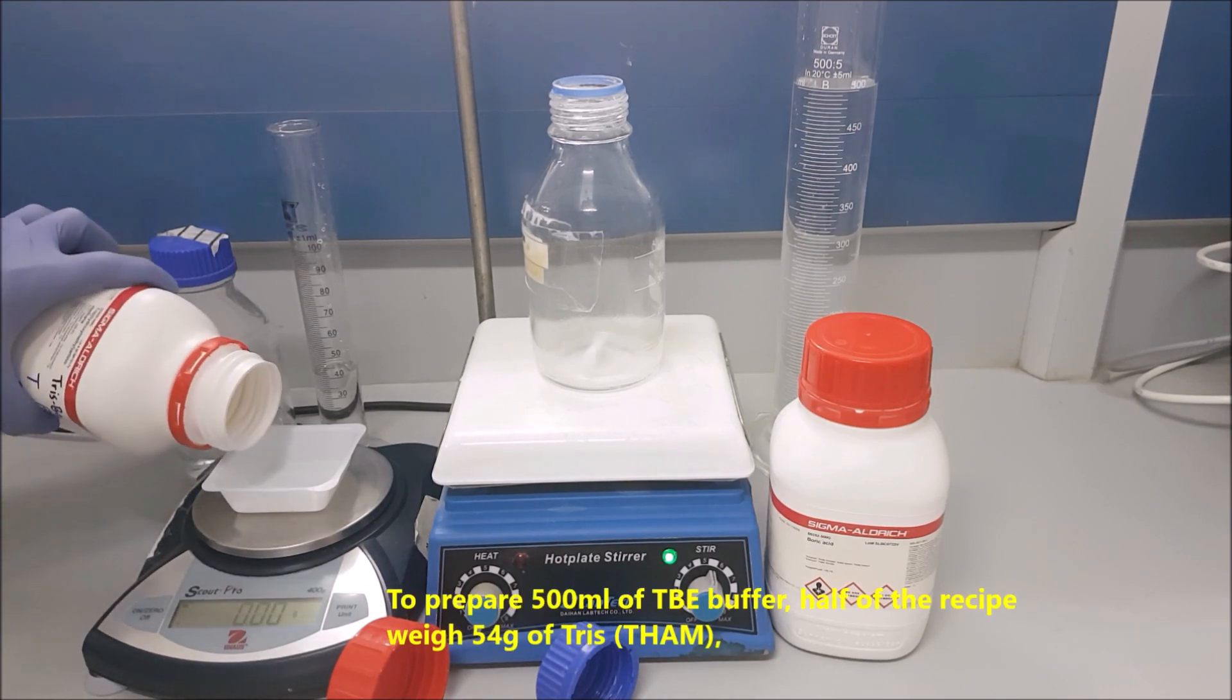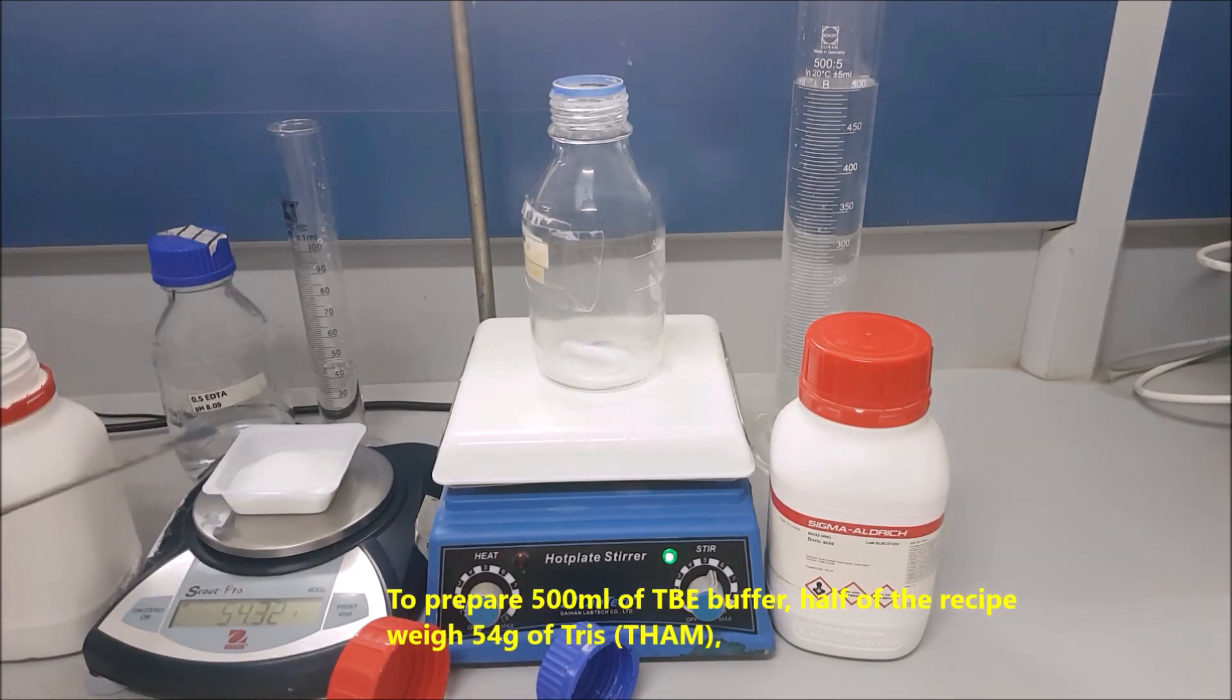To prepare 500 ml of TBE buffer, half of the recipe, weigh 54 grams of Tris THAM.